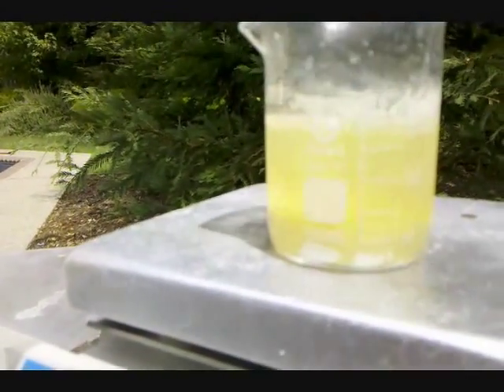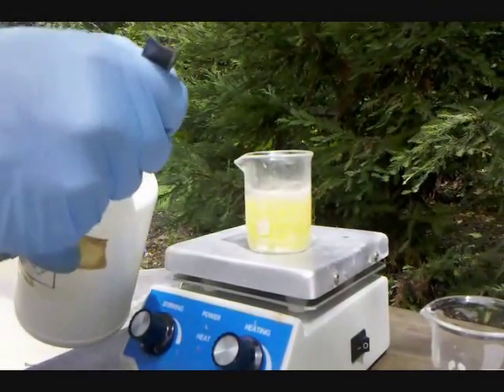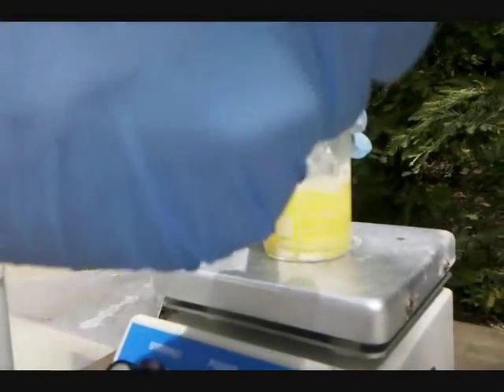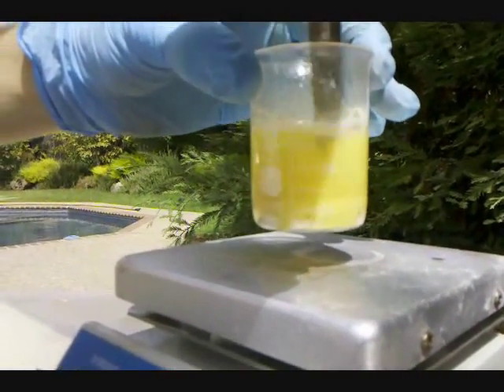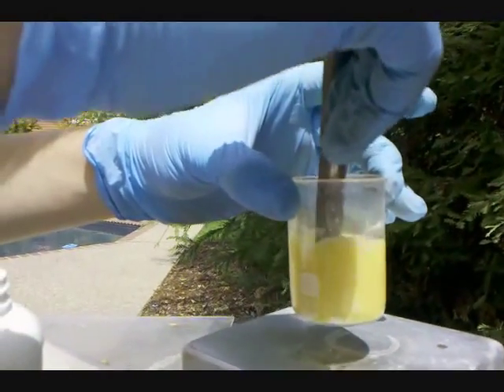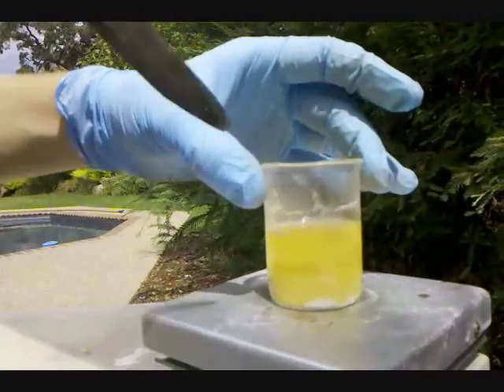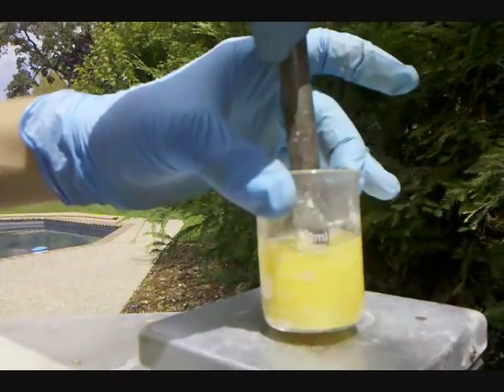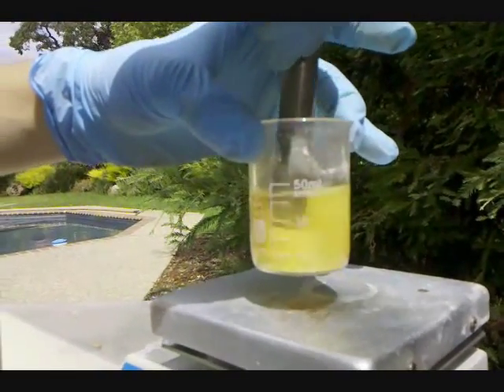Now there's still some Sub-Nitrate down there, so I'm going to be adding a little more Anhydrous Sodium Hydroxide. I've got to be careful — it boils kind of unpredictably. It's always safety first, so gloves and splash mask are very necessary. So I'll keep heating gently, stirring, and adding Sodium Hydroxide until all of the precipitate has turned to this yellow Bismuth Oxide.